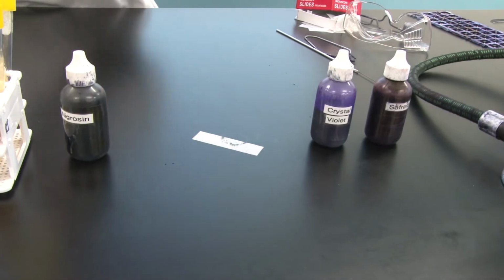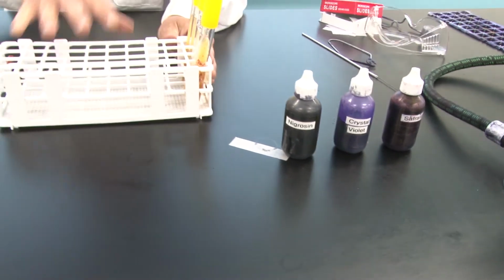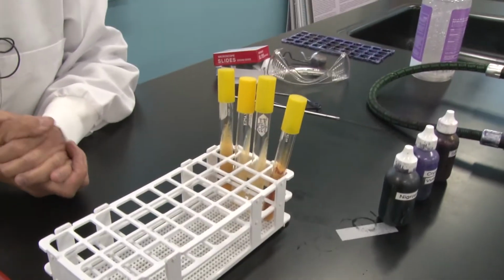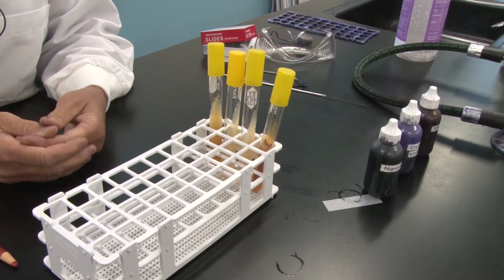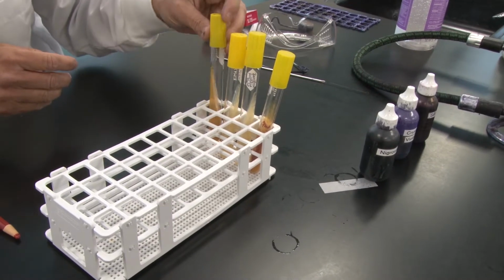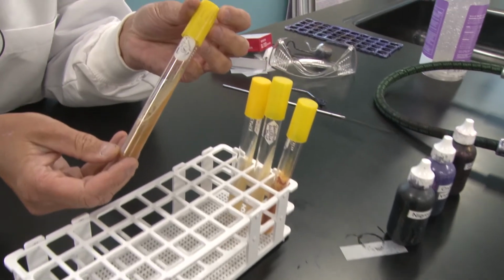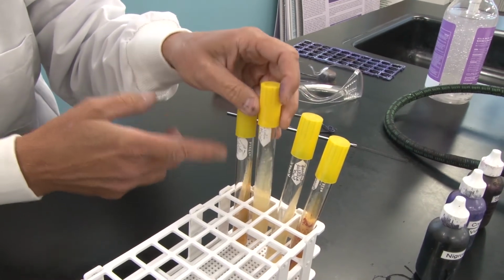I'm going to move your dye box out of the way, and we are going to take a look at the bacteria that we are going to use in this lab session. So at this point, we should talk again about the genus and species of bacteria. When we name our bacteria, we always give the genus. We know it is capitalized, and the species, and we know that's all lowercase. I have here our 4 stock bacteria for the day, and we are going to use Staphylococcus aureus. The genus is Staphylococcus, and the species is aureus.